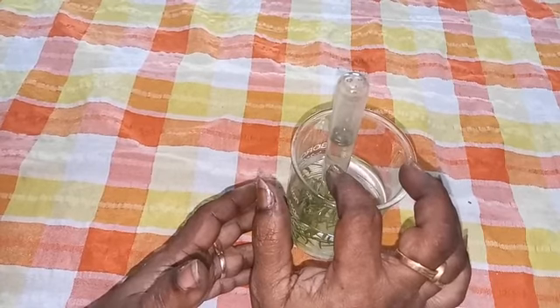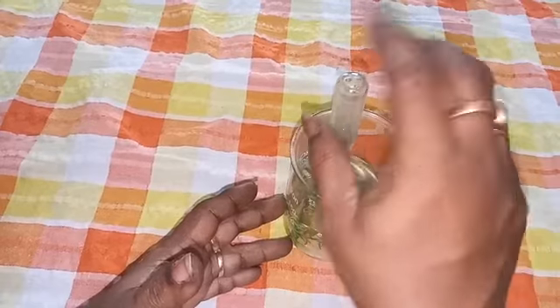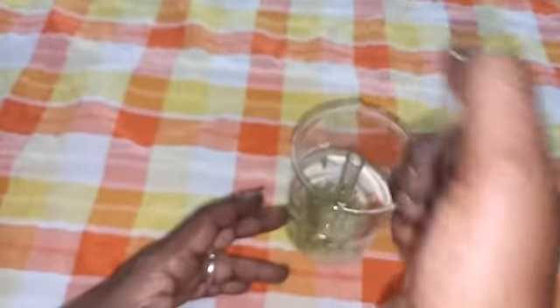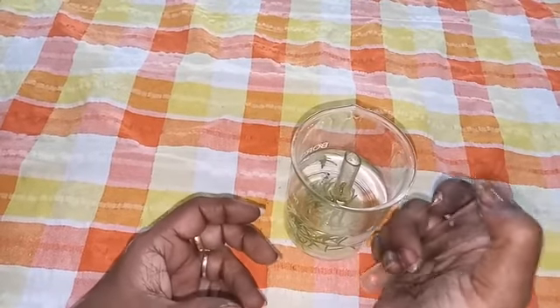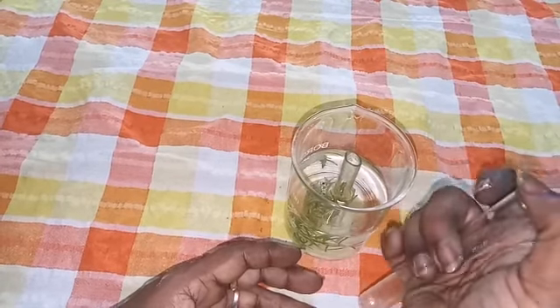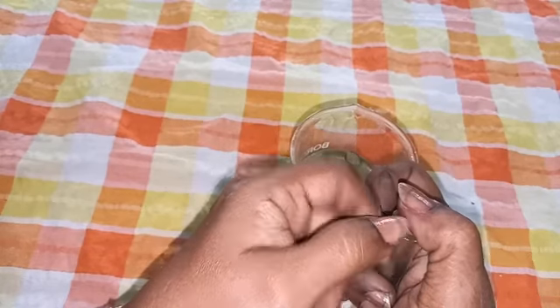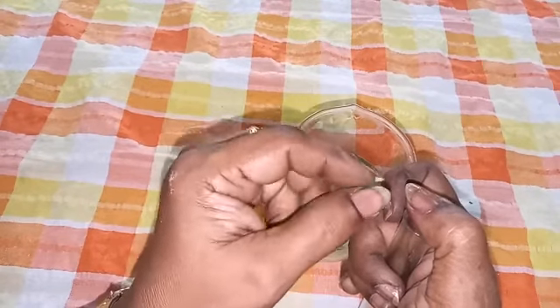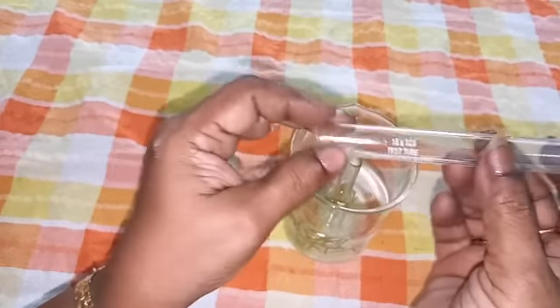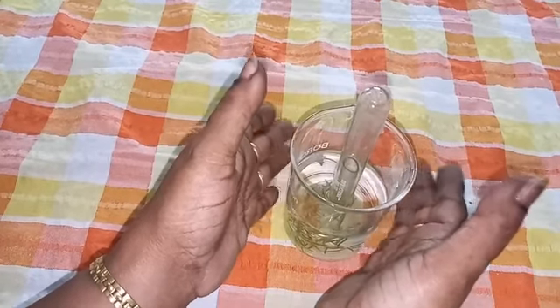Then, when the water has fully gone down, we have to take the test tube, closing it with a finger under water, and now one gas is there in this test tube. We have to prove that this is oxygen. If you bring a burning splinter near the mouth of the test tube, by opening it, it will glow with a bright flame. Why is it glowing? Because oxygen is there. You know, oxygen is the supporter of combustion. So this is the test tube and funnel experiment to prove that oxygen is given out during photosynthesis.